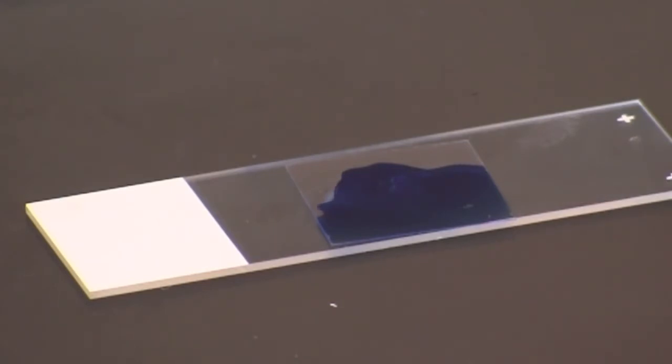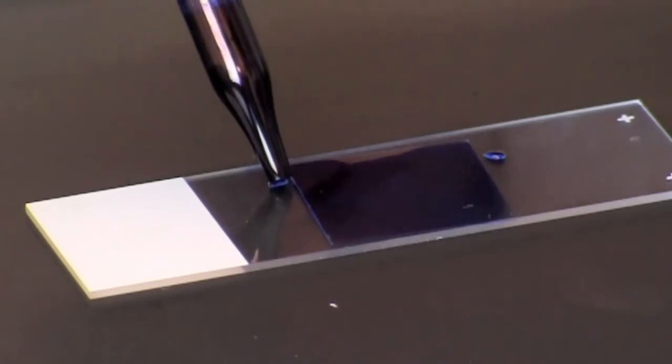If a bubble forms under the slide, additional stain may be added along the side of the coverslip.